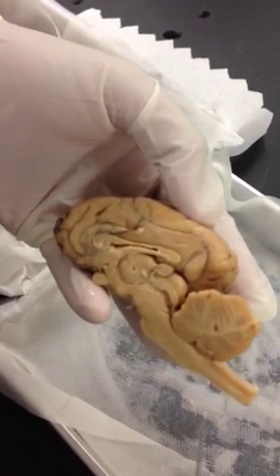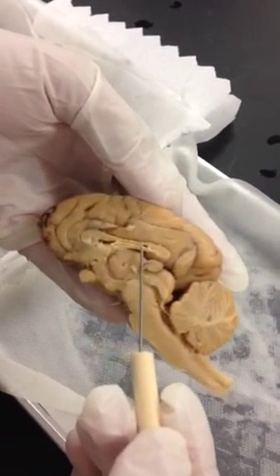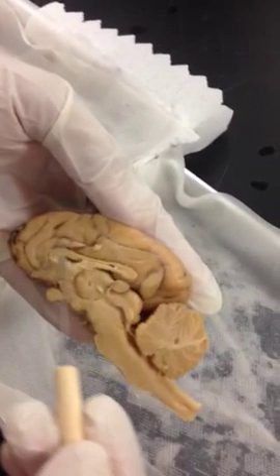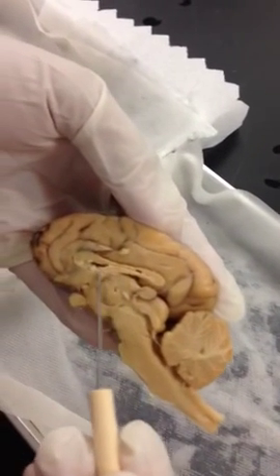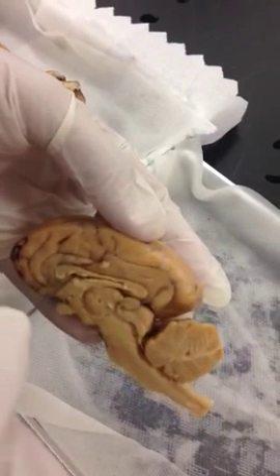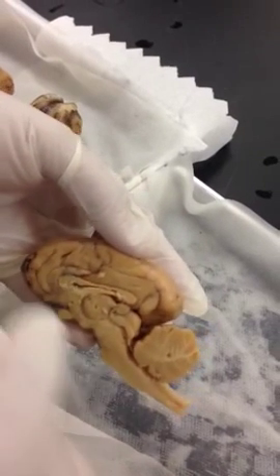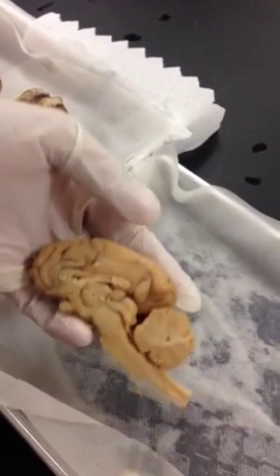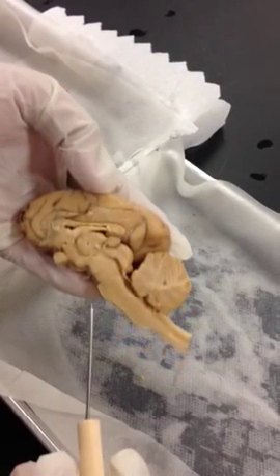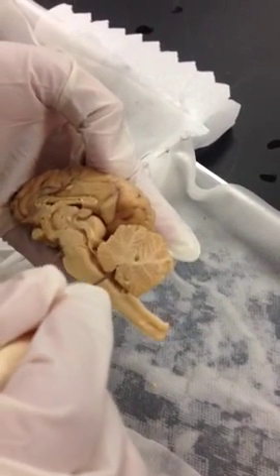Next. Septum pellucidum. Septum pellucidum is a membrane that covers and separates the two ventricles. If you see the membrane, then you won't see the space. So if you see the space, sometimes you may see partially the membrane and a little bit of the space depending on the specimen. Fourth ventricle. Fourth ventricle is down here between the medulla and the cerebellum.